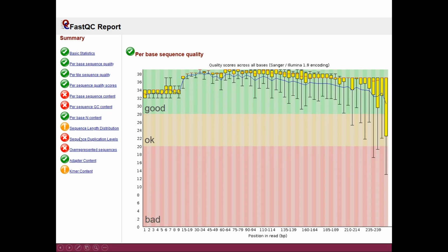But like I said earlier, these traffic lights, both in FastQC and in MultiQC, are very generic, so they don't know what type of data you have. For example, do you have amplicon sequencing, RNA-seq, ChIP-seq, whatever. And for example, if we look here, it gives you a red light for sequence duplication levels, but this is very normal for amplicon sequencing data because remember, we are sequencing essentially the same stretch.